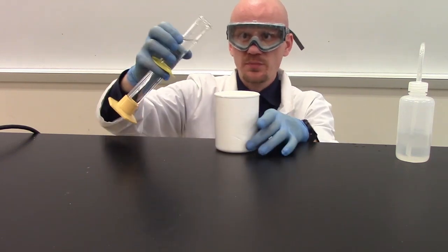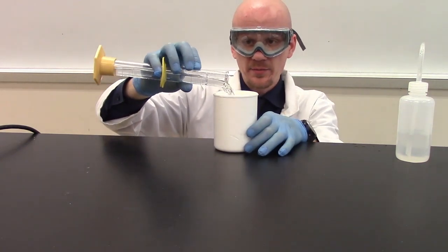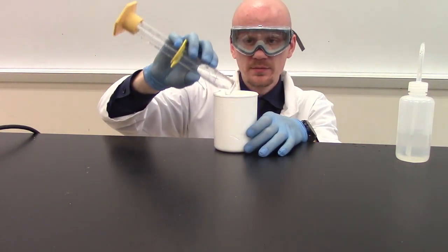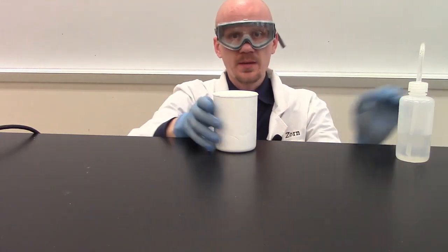And I'm going to take this and pour it into my calorimeter, like so. And I'm going to set this off to the side.